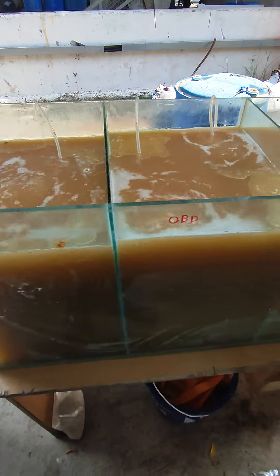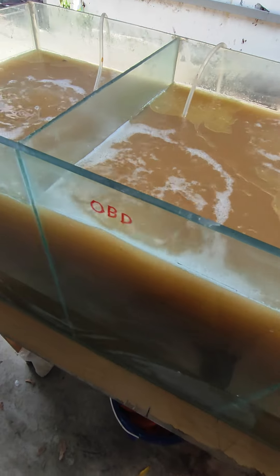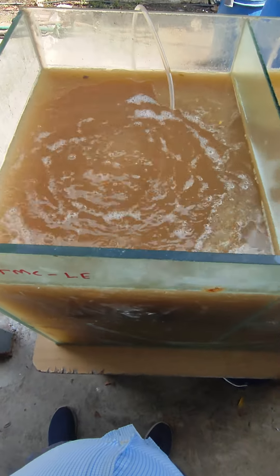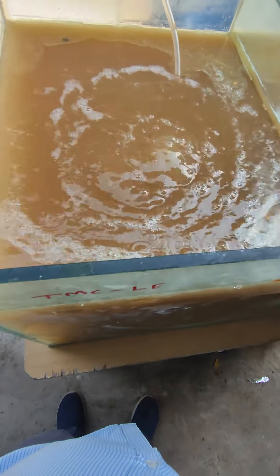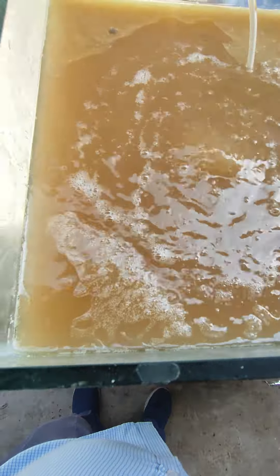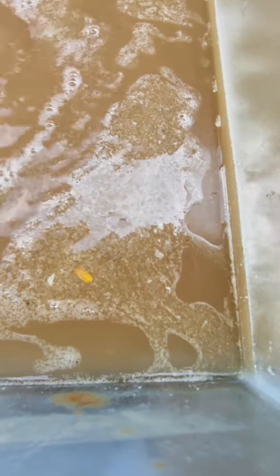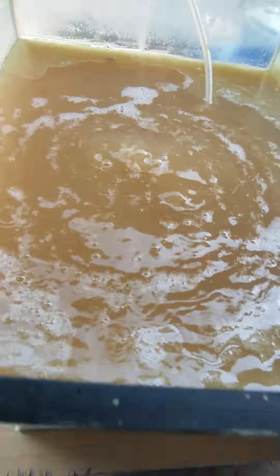After 6 hours, the oil is going to be degraded. We are going to study this. We are going to mix for 4 hours. In this tank, there is a lot of conversion. In this tank, the oil is going to be degraded.